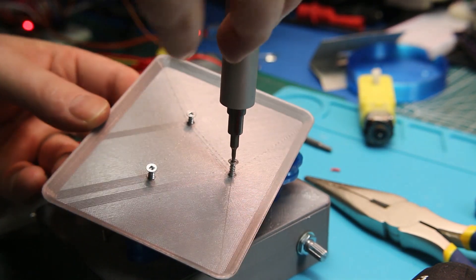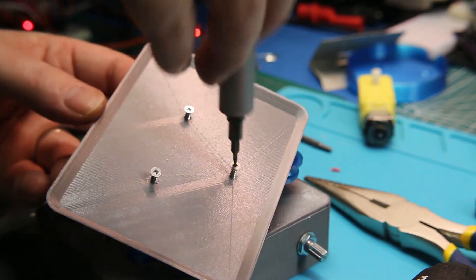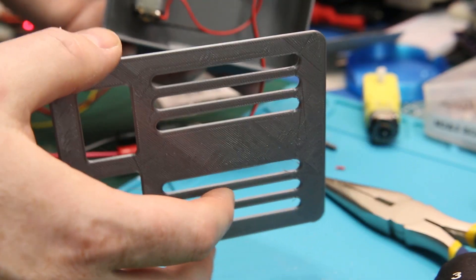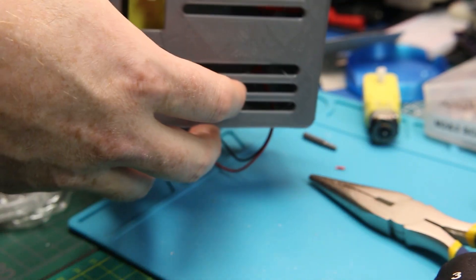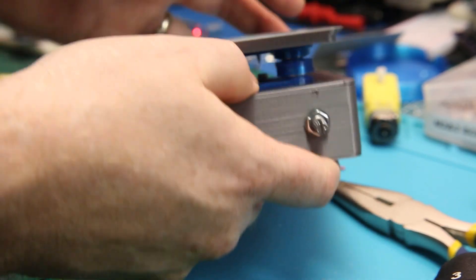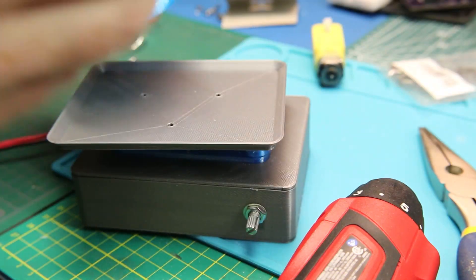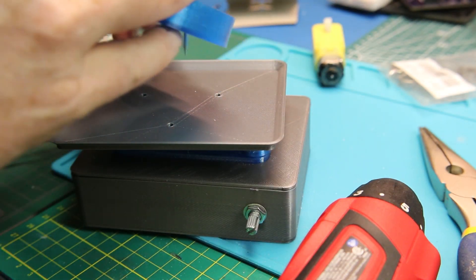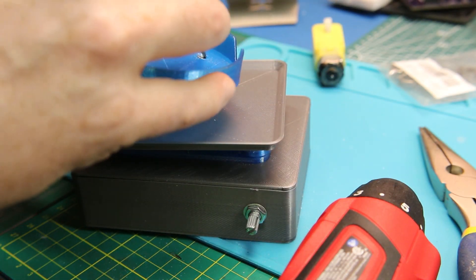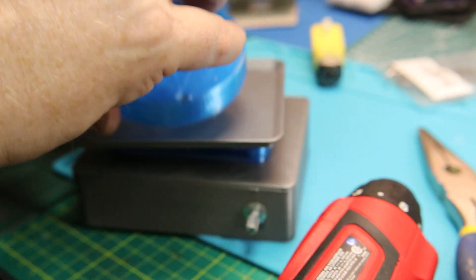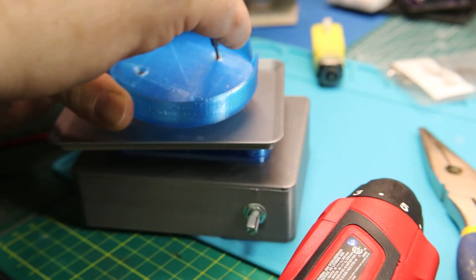This is just held down with three screws. Nothing to it. And a bottom cover to round things out. We are done. Adafruit also provided the files for a holder, a base to keep your jar or your flask from flying all over on the top.